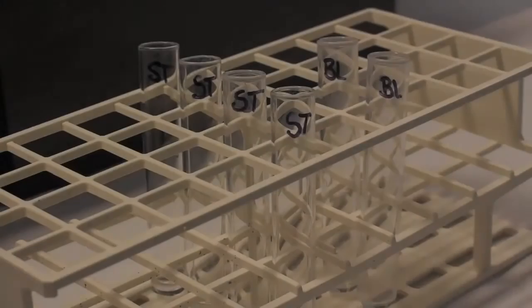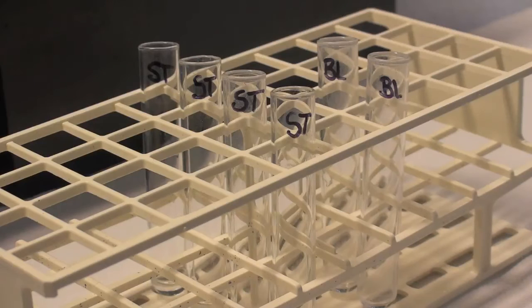With each set of determination, reagent blanks and fructose controls must be included and analyzed concurrently. The reagent blank consists of 0.3 ml of 100 millimolar sodium acetate buffer and 5 mls of PAHBAH working reagent. The fructose standard solution is prepared according to the booklet.